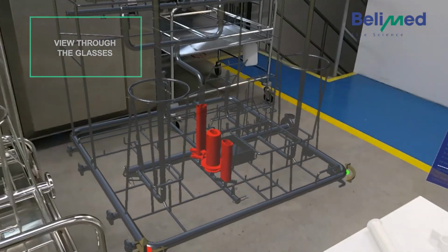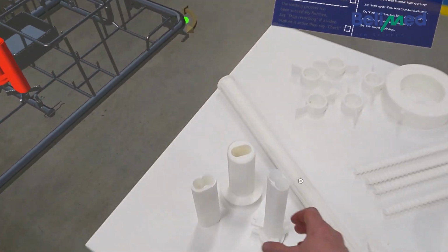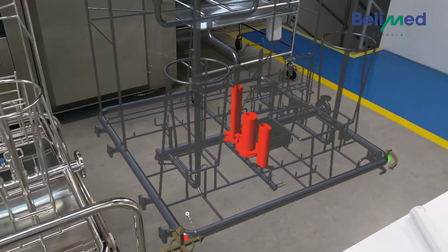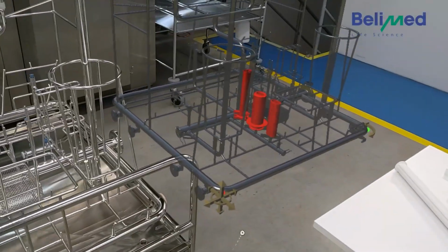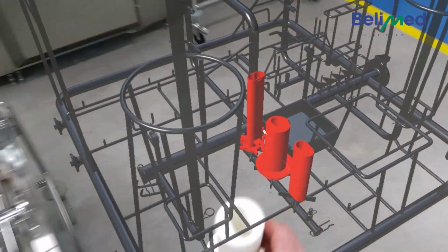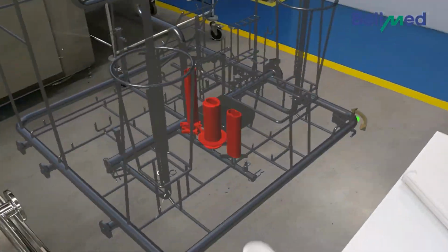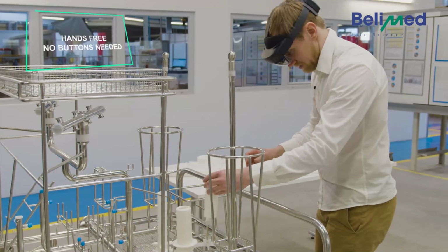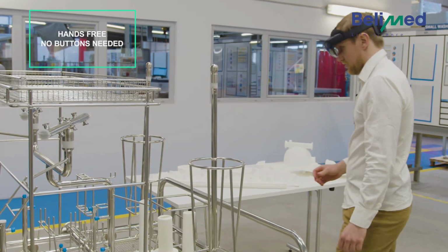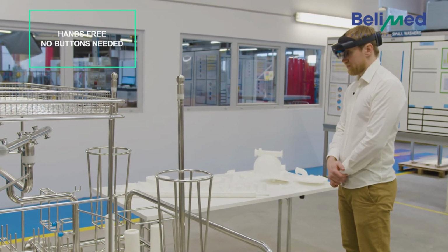So now we can see that the manual wants us to start with these three parts. We exactly have them here. So we take them and position them according to the virtual rack. So we have the big one here in the last position, the round one in the middle with the openings like that. So exactly do it the same. And the last part exactly positioned like this. So we continue by saying the word check.